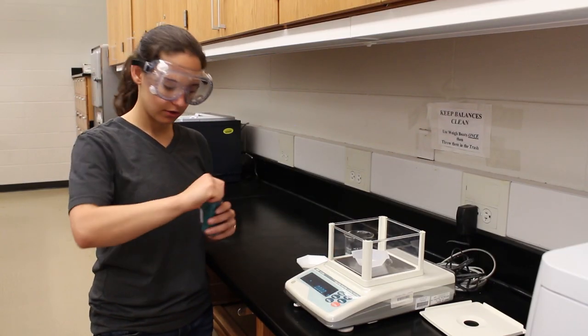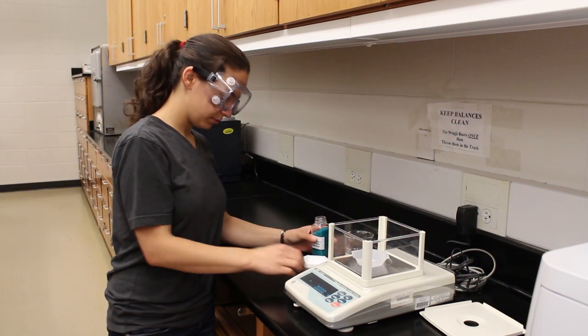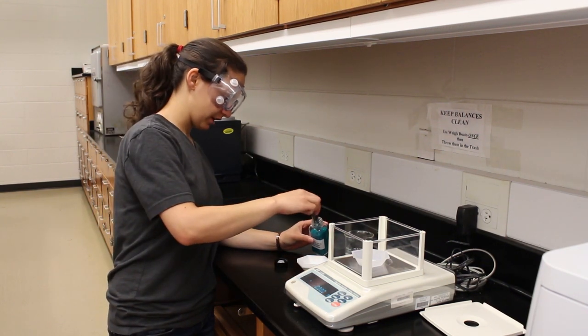Now, we can add the solid substance to the weighing boat. You'll be using a scoopula to add your substance to the weighing boat.